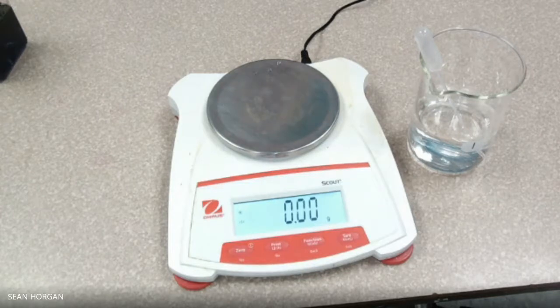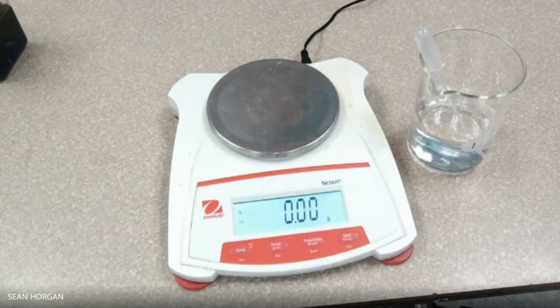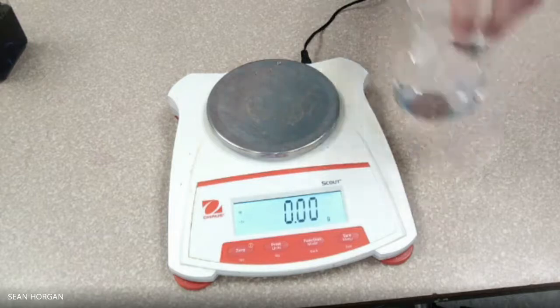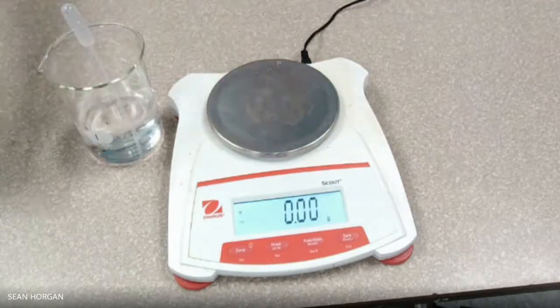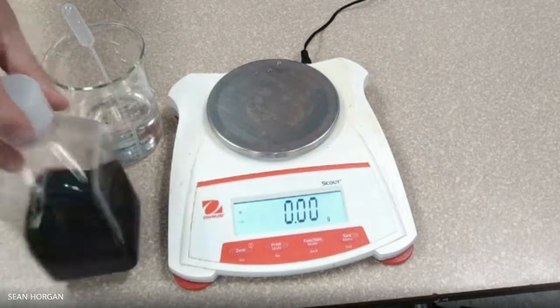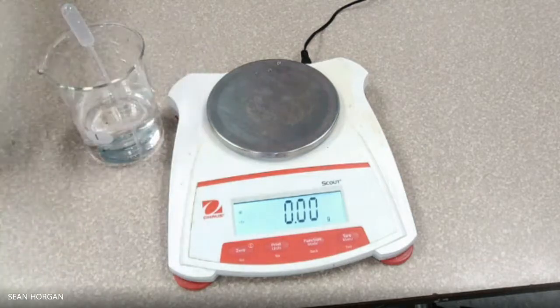So what we're going to do is measure the density of a known liquid — water — in liquid form, and an unknown, which we don't know, which is purple according to this thing over here.